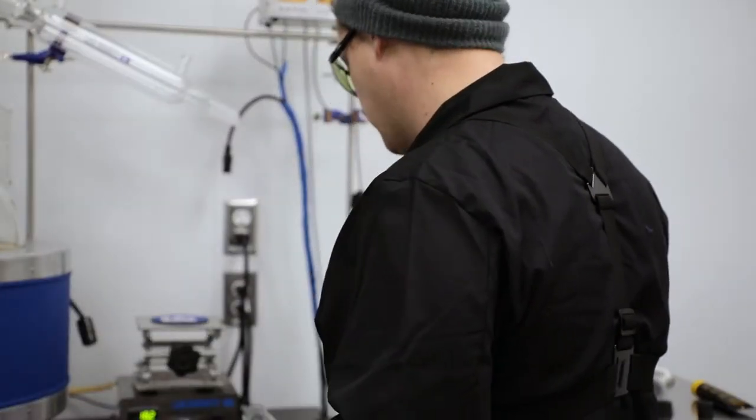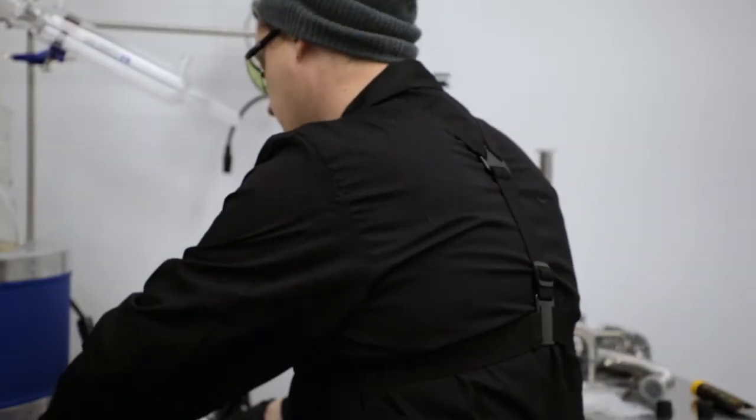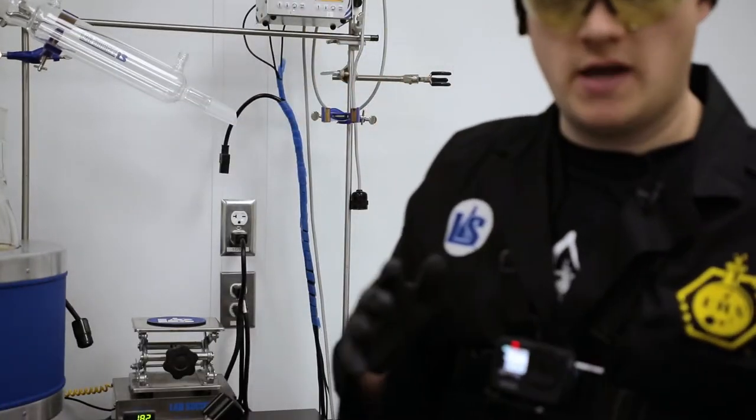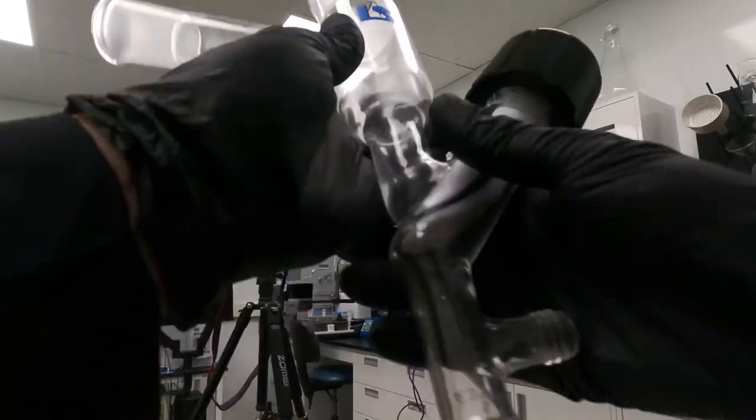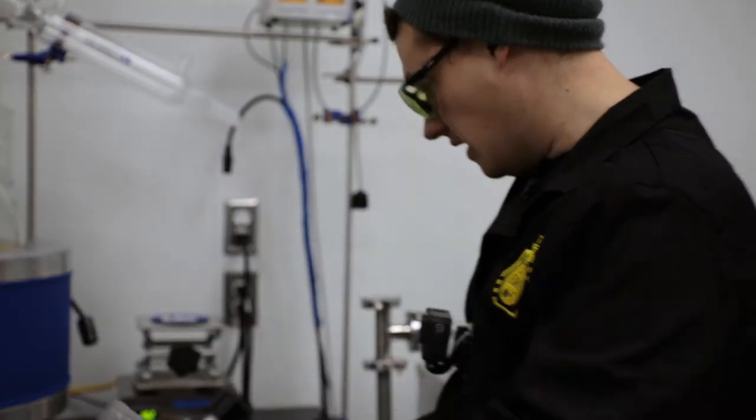First thing I'm going to do is, obviously I've already serviced my valve adapters, both of them. Typically I like to assemble as many things off of the system as I can, so because this piece I can kind of put together while it's not on here, it's a lot easier for me to do that.